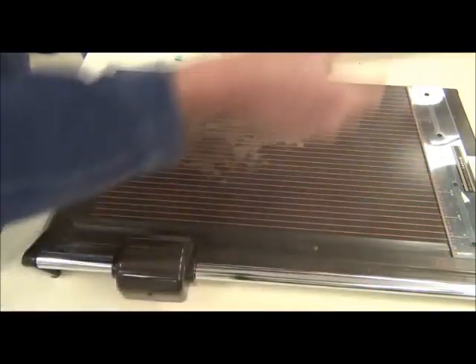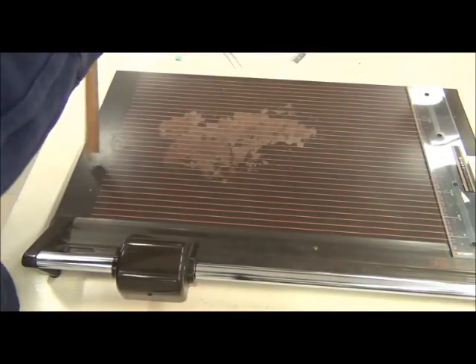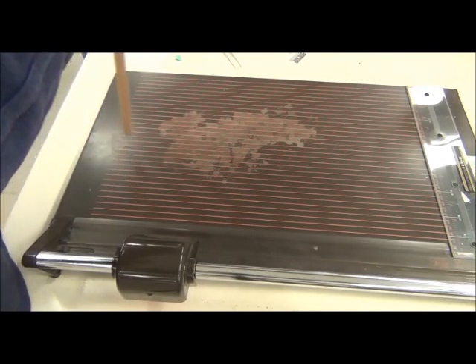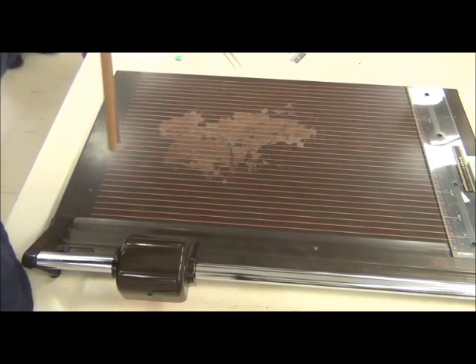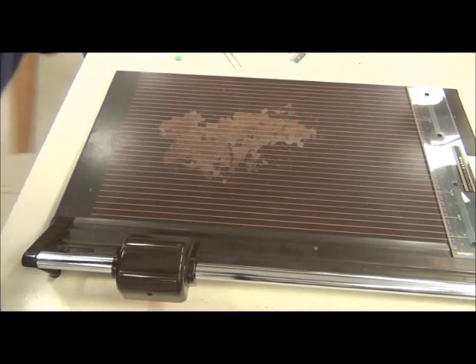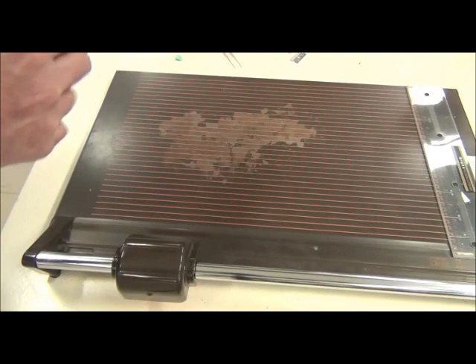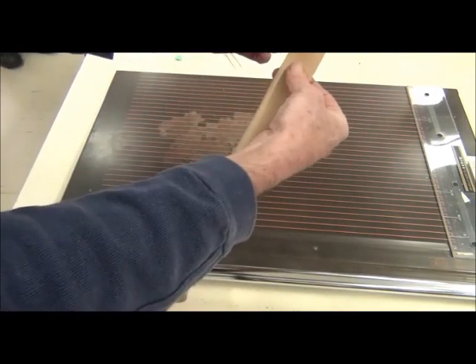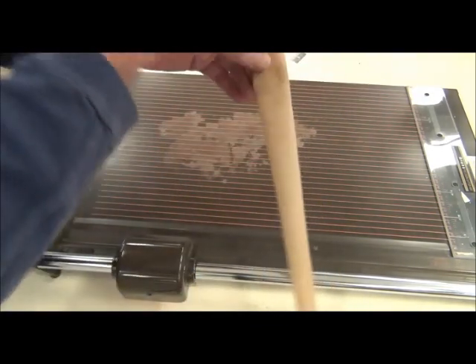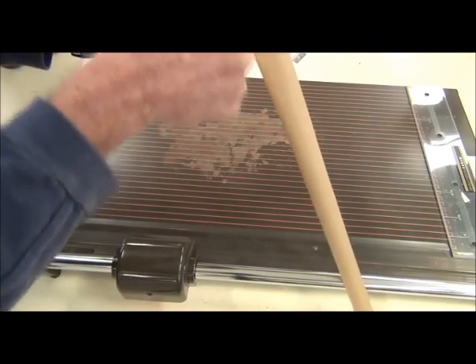Now mostly I think most of the tape is a bit wider than that, and if your tape's a bit wider that's good. This should be okay for most purposes. There might be some cases where this tape is just a little narrow for very large objects, in which case you'll just have to cut lengthways.